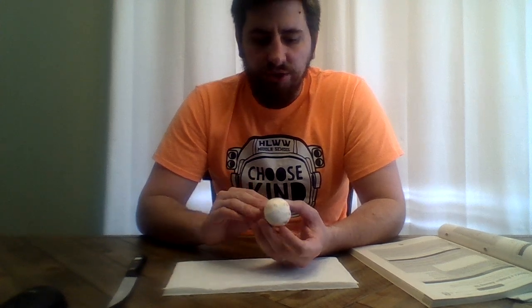Where do you think the cap is? If you're looking at a mushroom, where do you think the cap is? Well, it makes sense that the cap is on top. The cap is on top because it protects the mushroom, and specifically it protects the gills, which create the spores for the mushroom to reproduce. So the cap is on top. The classic looking cap of a mushroom is sort of a protection.